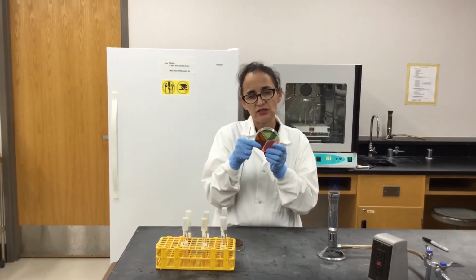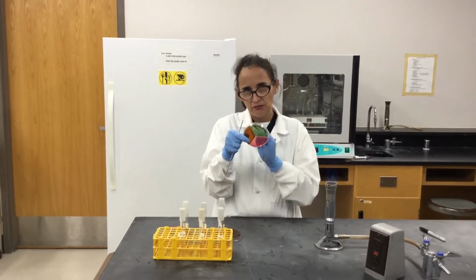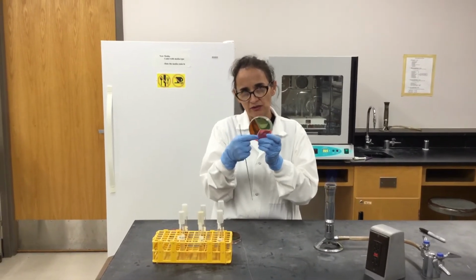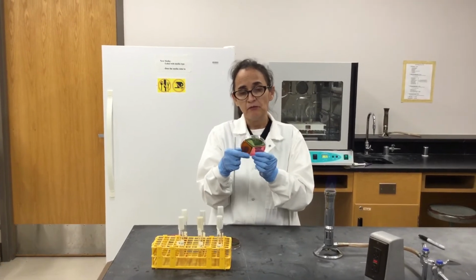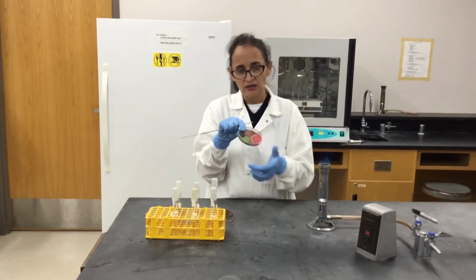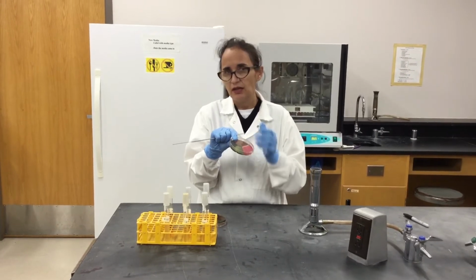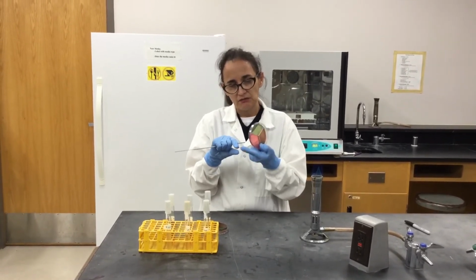In some cases you have a single type of media in a petri plate without segments, and then you can mark the bottom of the petri plate making the segments that we perhaps have done before. But sometimes when you are inoculating these segments without the marked segments in the petri plate, without this physical constriction, the bacteria can go from one place into another one. But this is very convenient.